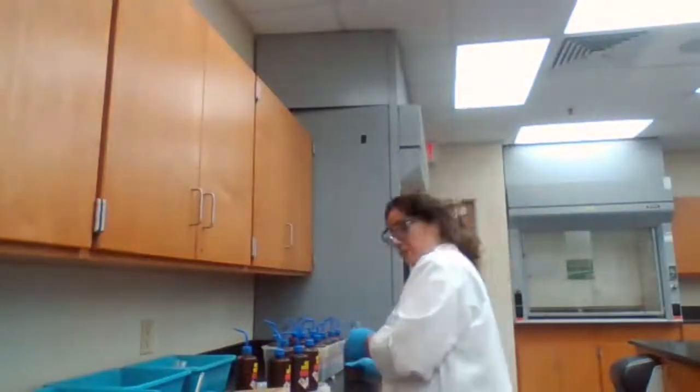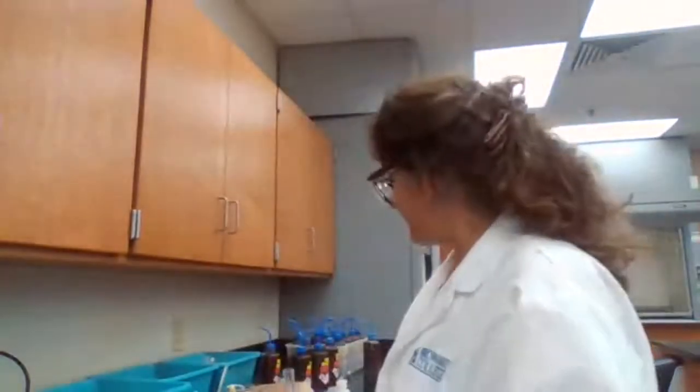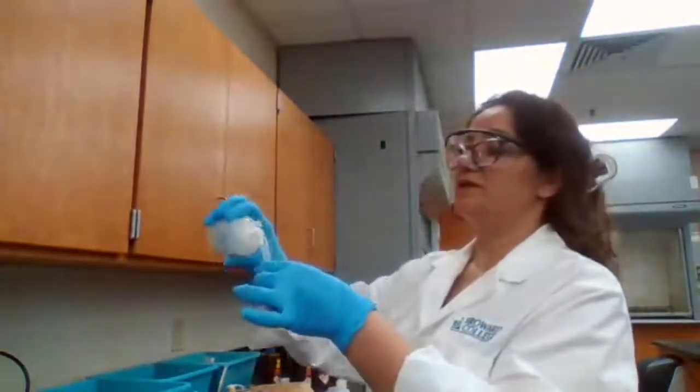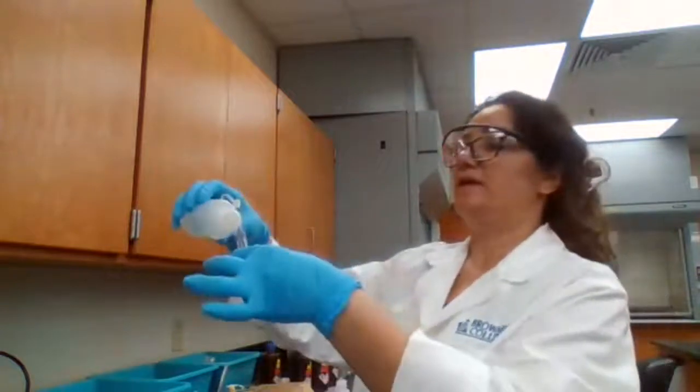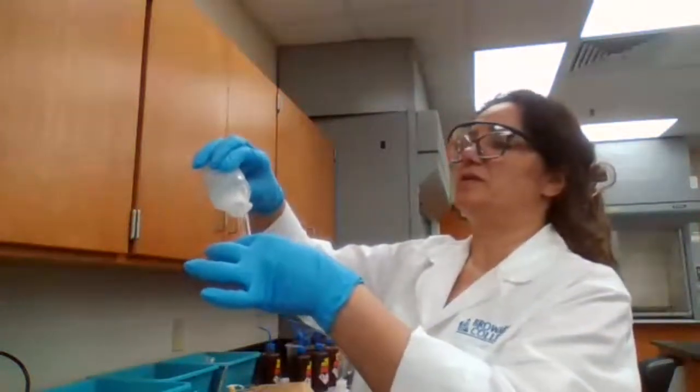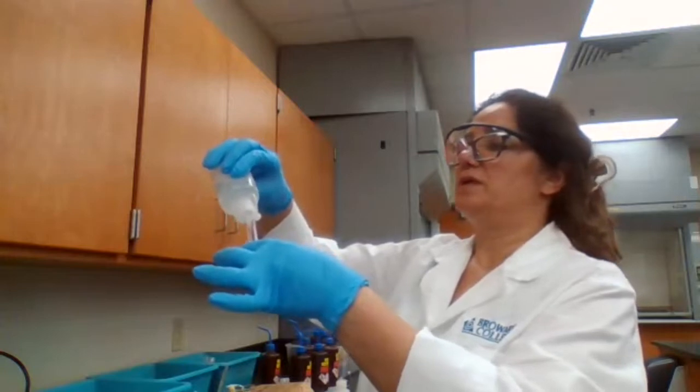I am going to add the 15 drops of sodium hydroxide, because that's what the procedure is telling me to add. 1, 2, 3, 4.